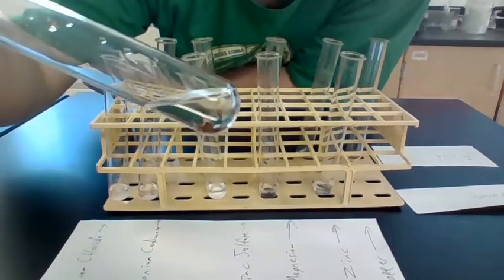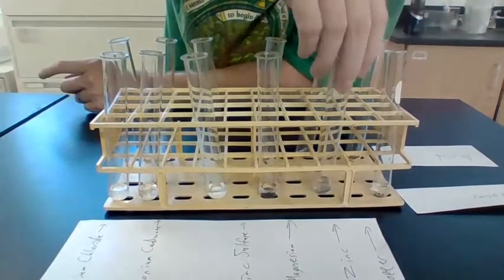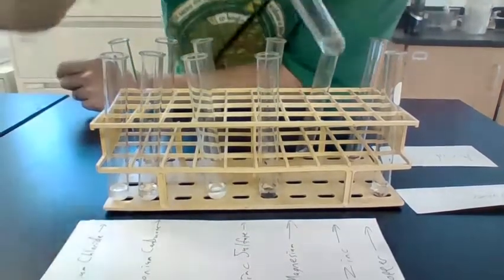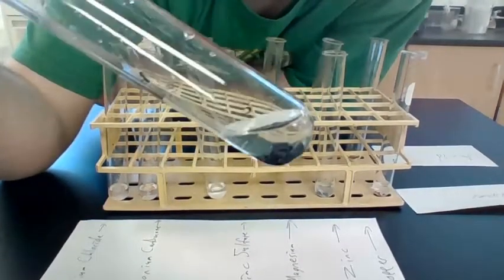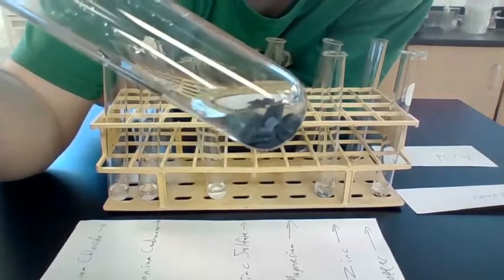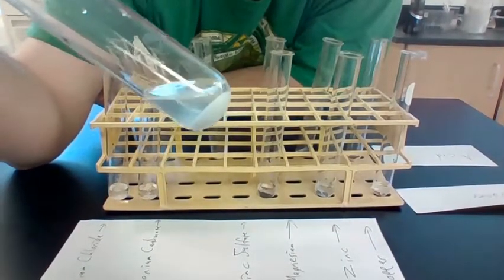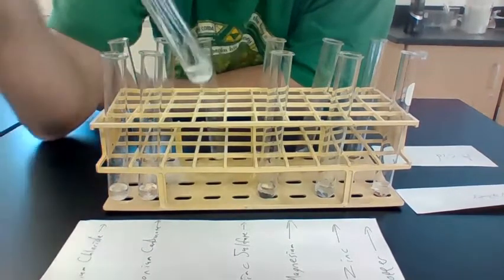The copper still looks like it's solid and orange in there. The zinc still looks silver and jagged. The magnesium still looks gray, maybe a little black, and not very jagged. The zinc sulfate doesn't look to be dissolving. No reaction with water.